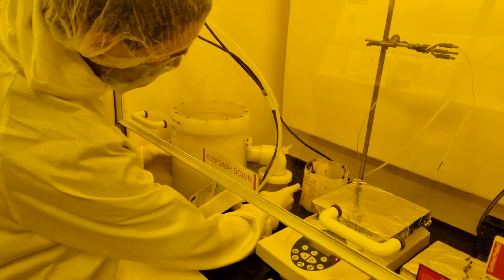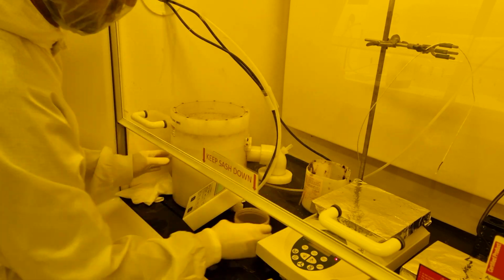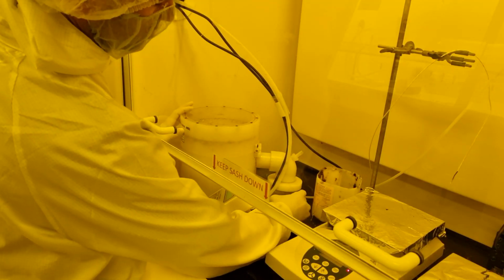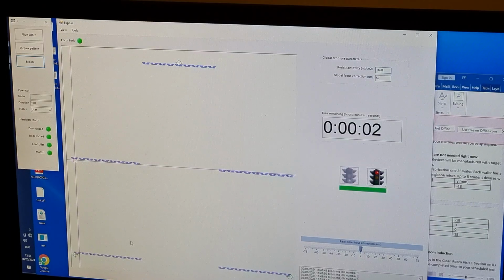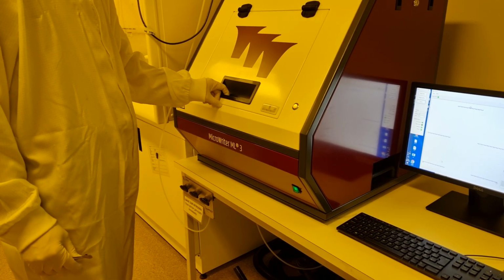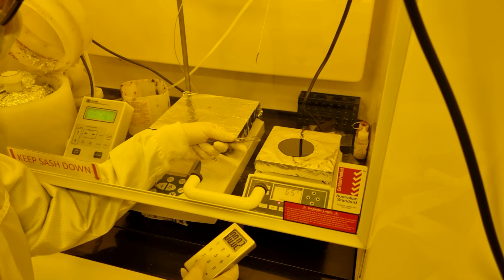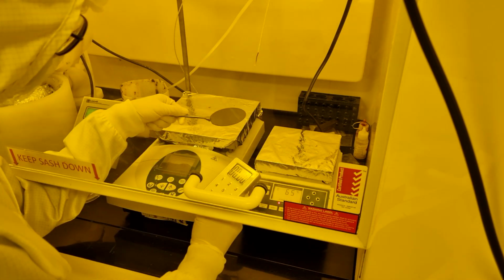While the machine is writing the pattern, finish cleaning up the spinner. This probably means emptying the waste trap into the common waste container. When the wafer is finished writing, remove the wafer and perform the post-exposure bake. This is usually a bit shorter than the soft bake, but is very similar. This application of heat after exposure is necessary to complete the chemical reaction that cross-links the exposed photoresist.